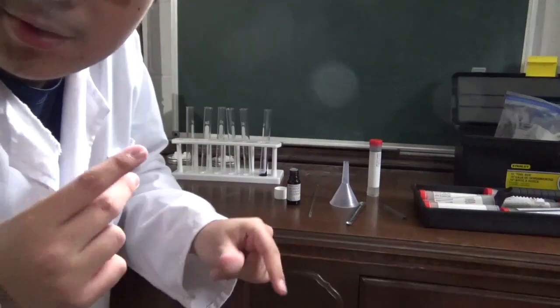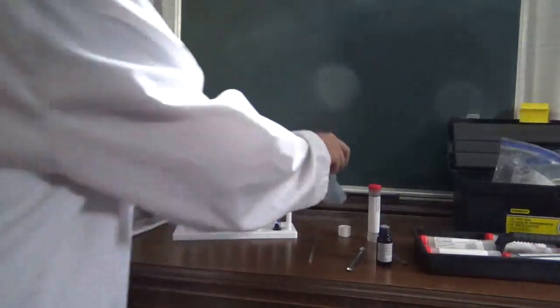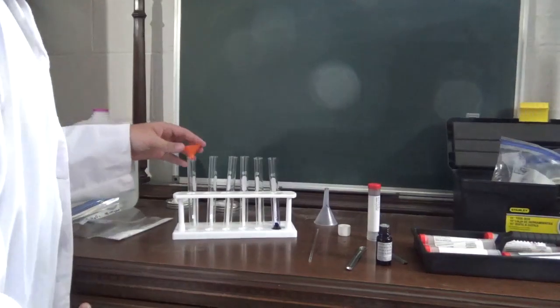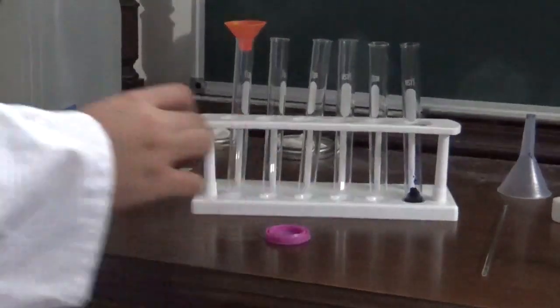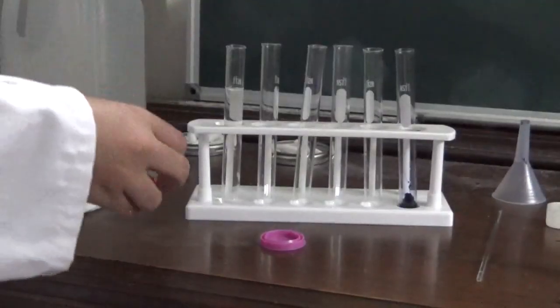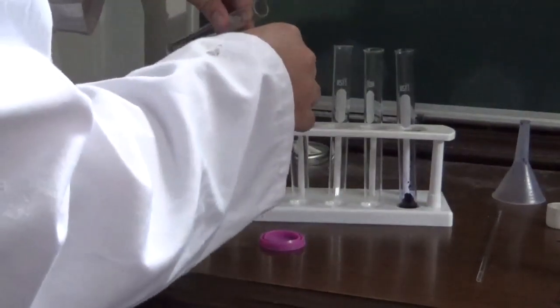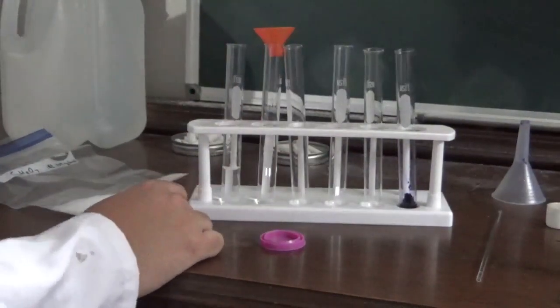All right, I can't find my vinegar, so you know what, we're going to use citric acid, which is an acid, of course. And so what we will do is, first of all, I'm going to use a smaller funnel, which will work just fine. We'll transfer some water into here, just like so. And that's a little too much, so we can actually transfer this to another test tube.